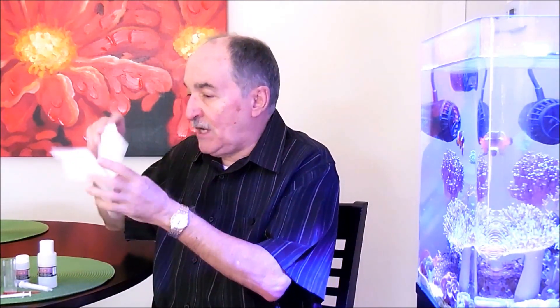Besides the instructions, you also have the scale, so when you get the reading you can read off, and here it will tell you the average, if it's within or not. So let's start.